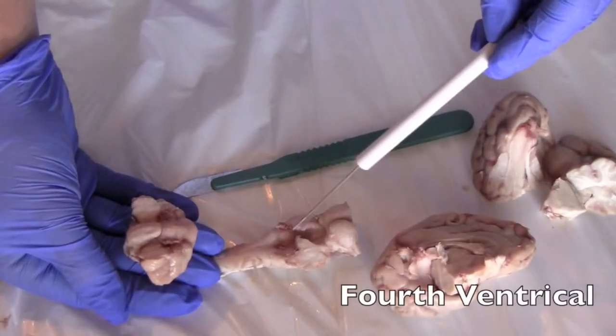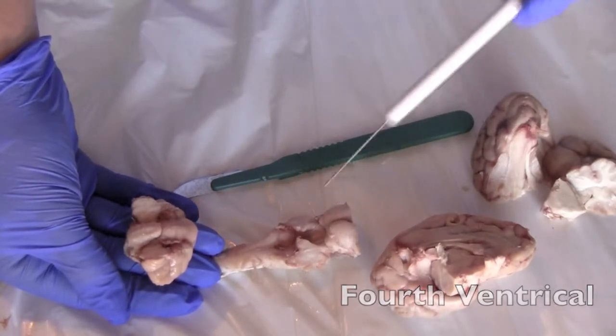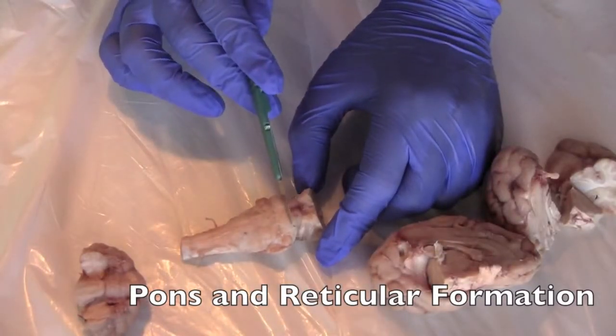Now we're looking at the floor of the fourth ventricle, which also carries spinal fluid. So here we have the pons, which we're about to cut through.